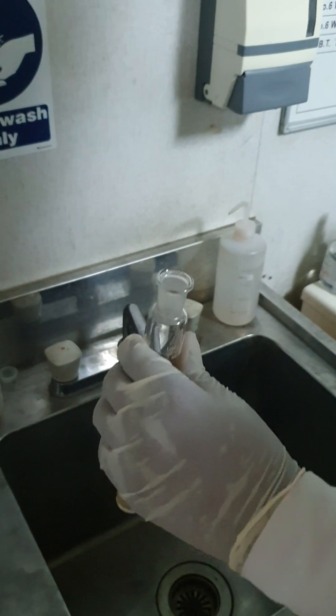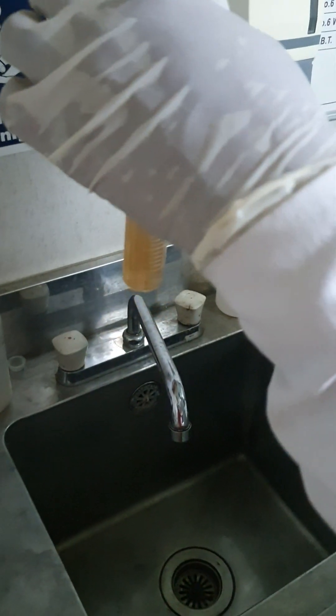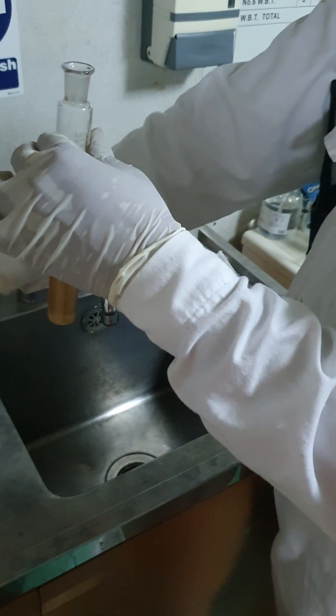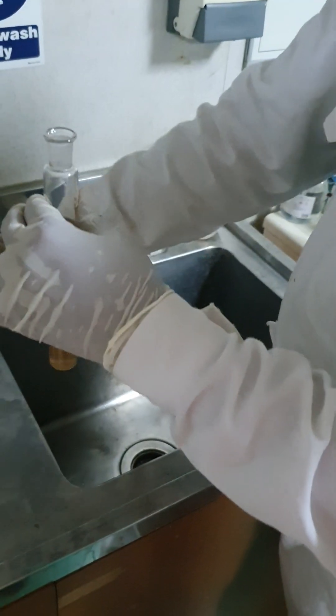Actually, this color should be red color, not like this. The problem is that our potassium permanganate already expired. That's why this color is like this.